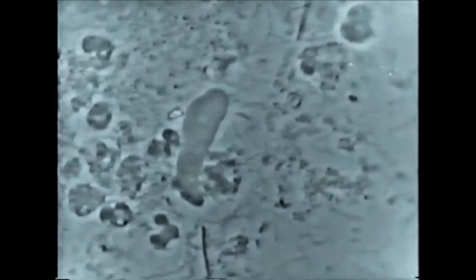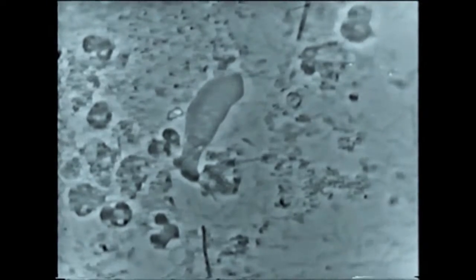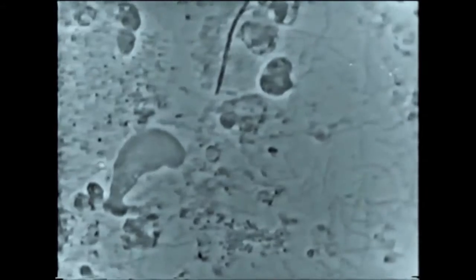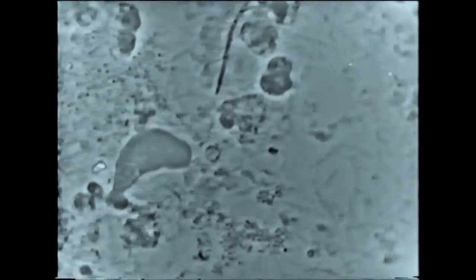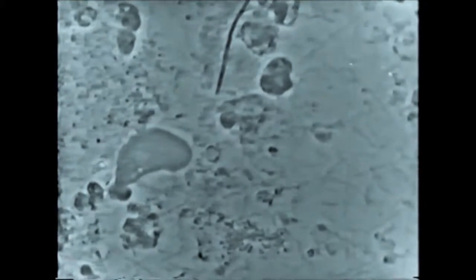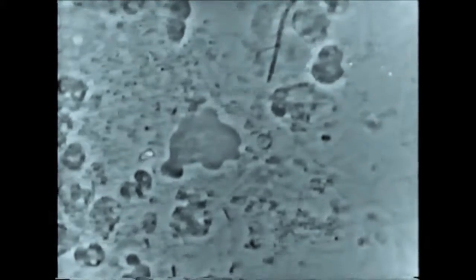This is a specific biofilm in a case of periodontitis — in this case, a pregnancy periodontitis. What we see in the middle is an amoeba, Entamoeba gingivalis, surrounded by a lot of bacteria: spirochetes and vibrios. We also see some PMNs — white cells, broken white cells. It's like a pus formation.